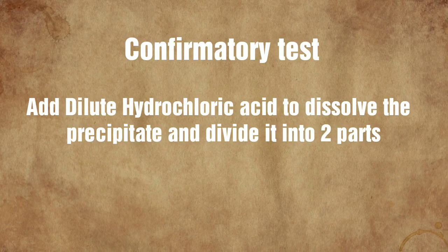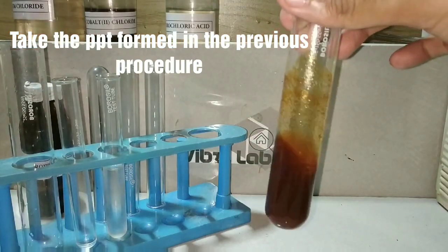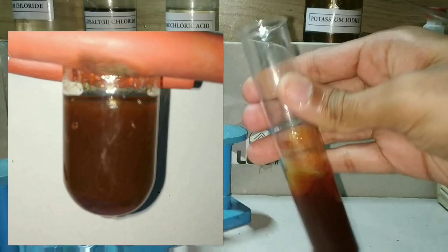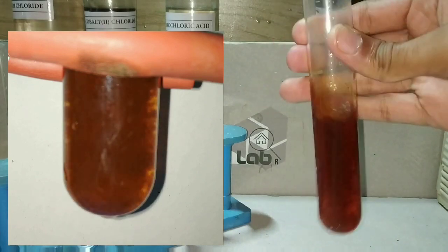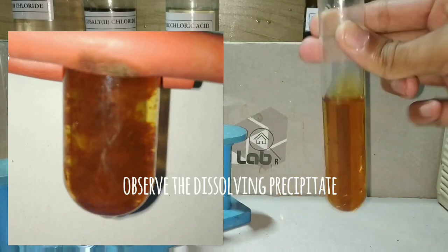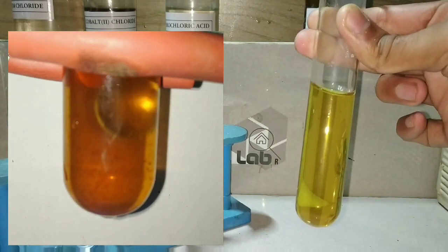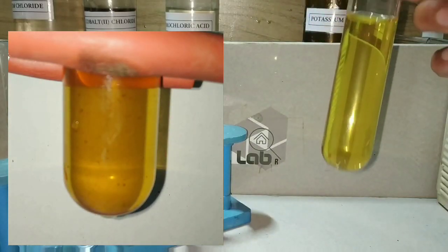We will be taking the precipitate formed in the previous procedure and adding dilute hydrochloric acid. You can observe that on adding hydrochloric acid, the reddish brown colored precipitate starts to dissolve slowly and the previous yellow color is re-obtained. Now you can see that the precipitate has completely dissolved and the solution has turned clear yellow in color.